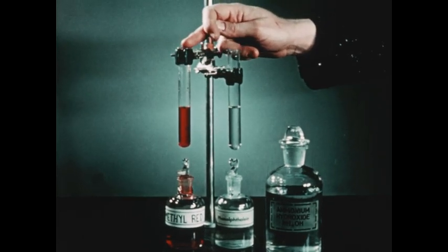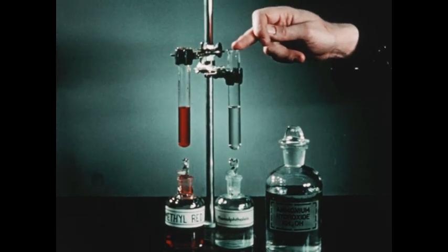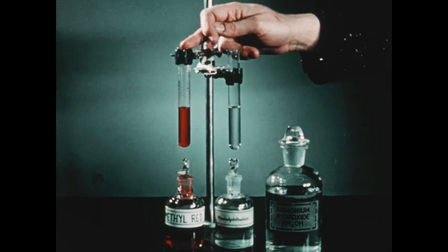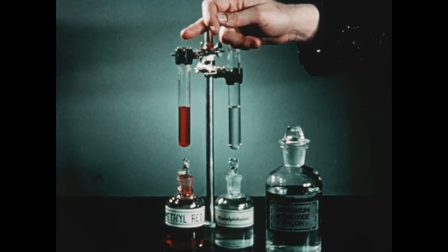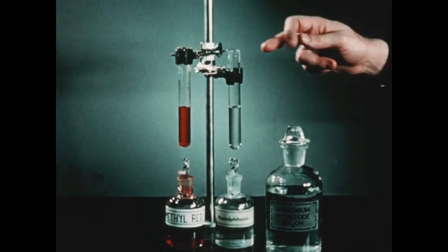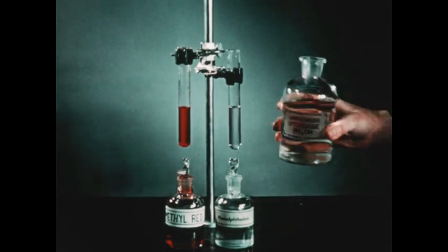In this tube, we have some distilled water containing a drop of methyl red indicator, and in this tube, water containing some phenolphthalein indicator. To this tube also, I've added one drop of hydrochloric acid, so that the indicator is now exhibiting its red or acid color. Now to each tube, I'll add a few milliliters of ammonia water or ammonium hydroxide.